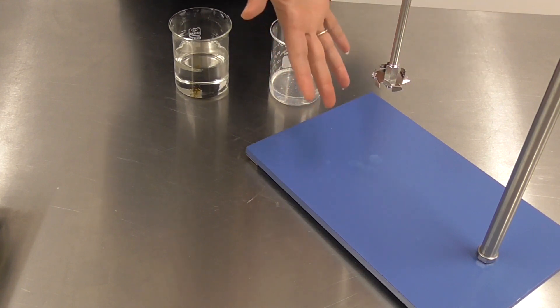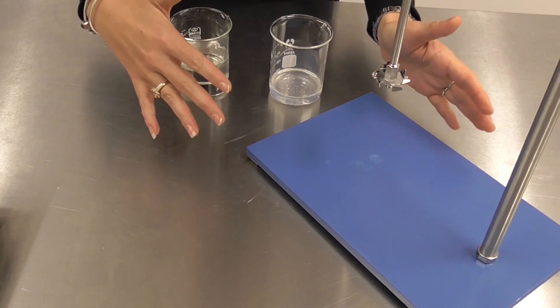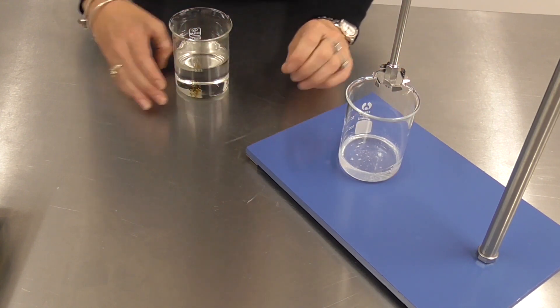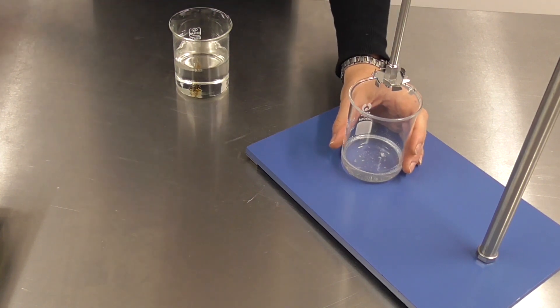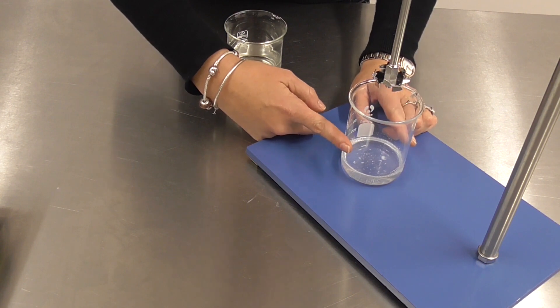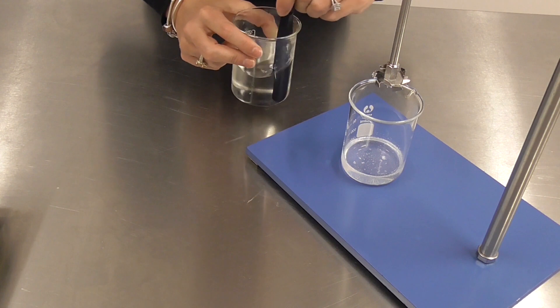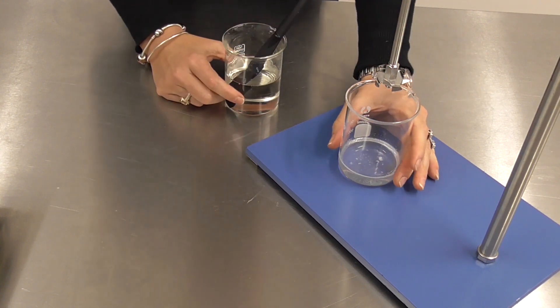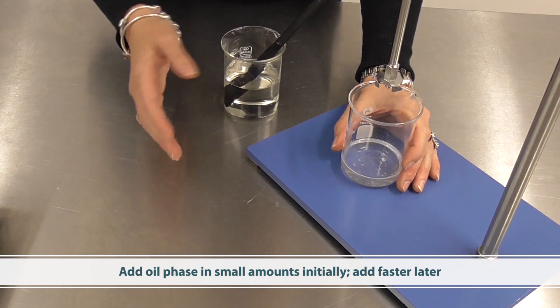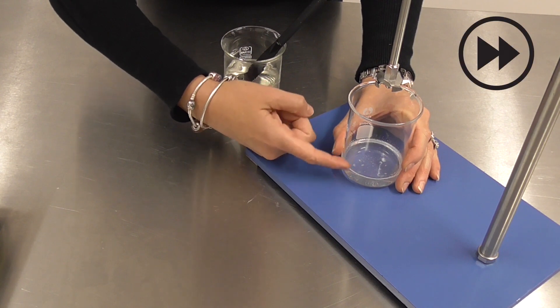You do need to process sucra gel correctly, and you do need good equipment in the lab. You need to appropriately scale up with the right type of shear — hand mixing at home is not sufficient with this material. So invest in some good equipment if you're going to use it. Here I have my sucra gel already measured out and my oil phase measured out with the antioxidant in there. One of the tricks when using sucra gel is to add the oil phase to the sucra gel in small amounts to begin with; once you've added about a quarter of the oil phase you can then add it faster. As you mix, look for glossiness and a homogeneous mixture as you add the oil.